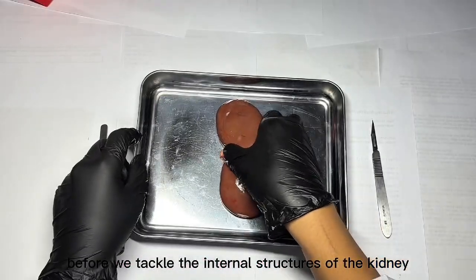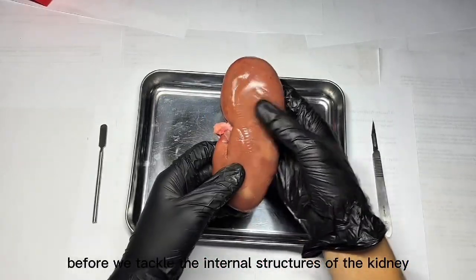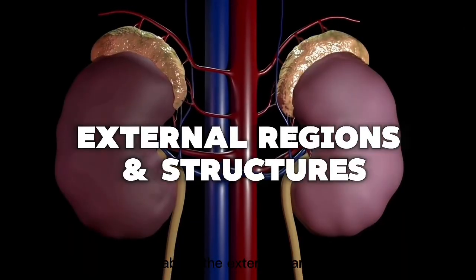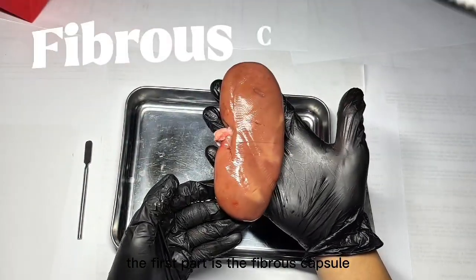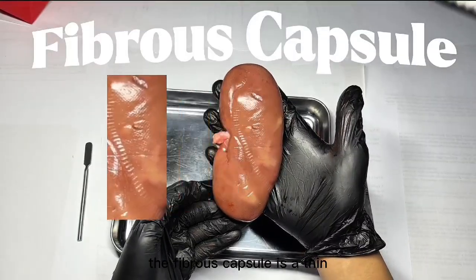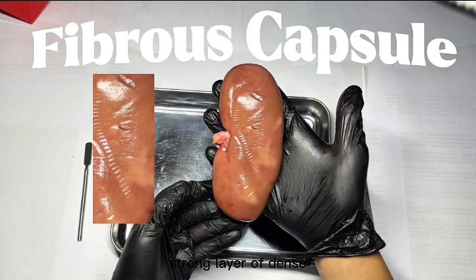Before we tackle the internal structures of the kidney, let's first talk about the external parts of the kidney. The first part is the fibrous capsule. The fibrous capsule is a thin, strong layer of dense connective tissue that tightly encloses the kidney, providing protection against trauma and infection while maintaining the organ's structural integrity.